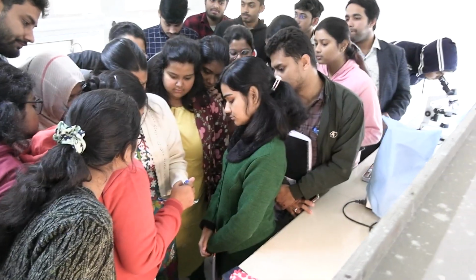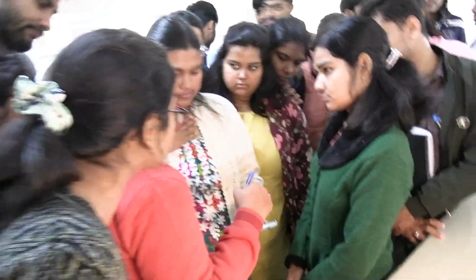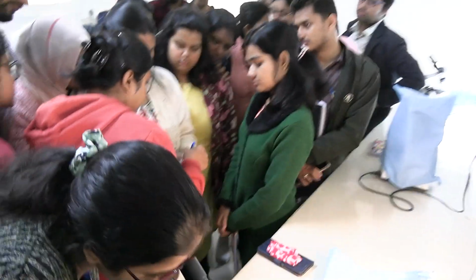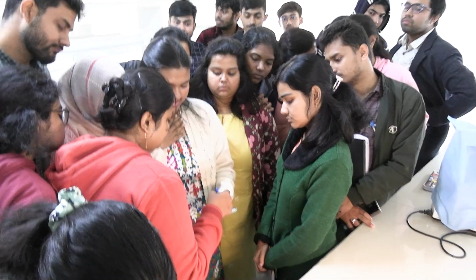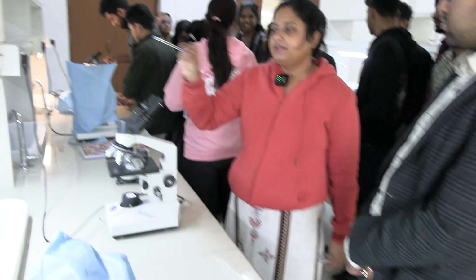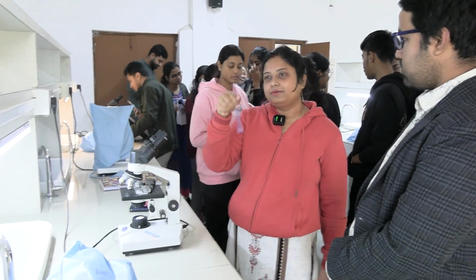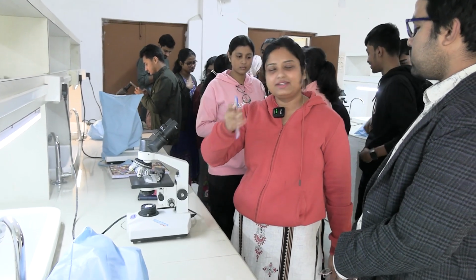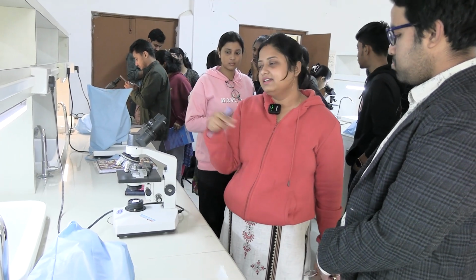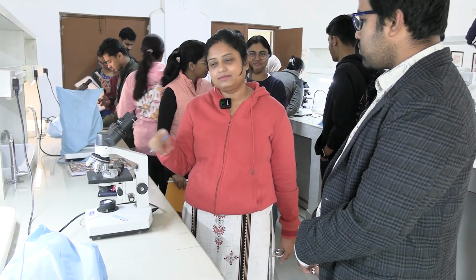And this is one section of respiratory bronchiole. Okay. So you see the sections, they are lined by epithelium like this. Terminal bronchiole: this one is the terminal bronchiole. This one is the respiratory bronchiole. Okay, understood? Here on this side, in the upper part, you can see some sections of alveoli lined by flattened squamous epithelium. On this side, the rounded structure is a section of terminal bronchiole. Okay, you can see a layer of muscle in the wall, and here the longitudinal section of the respiratory bronchiole is present. You can see the alveolar duct is connected with the alveoli, and the respiratory bronchiole is also connected with the alveoli.